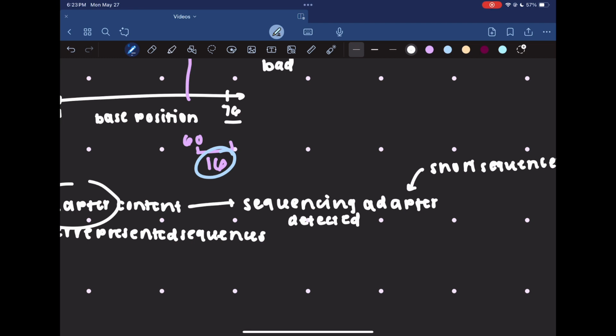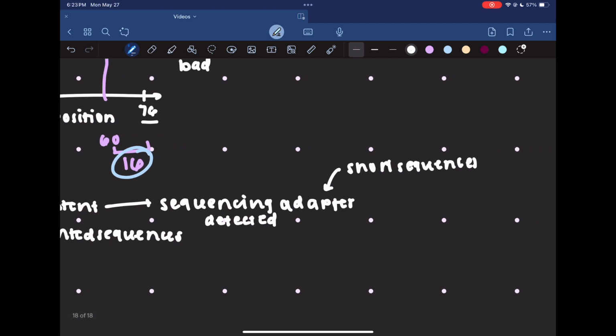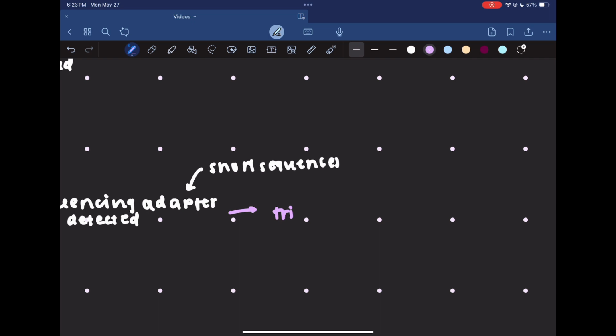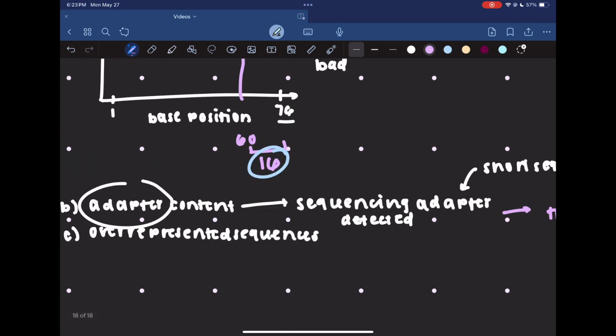So FASTQC can actually detect whether or not these adapters are present. And you'll see that there'll be kind of a graph that indicates the presence of those adapters. So if you see that there are adapters present in your sample, you're going to want to go on to trim those adapters off, because that is a big priority, is making sure that the adapters are gone.